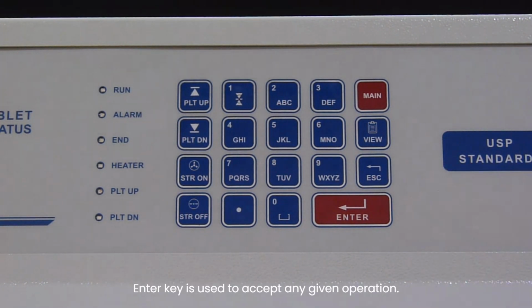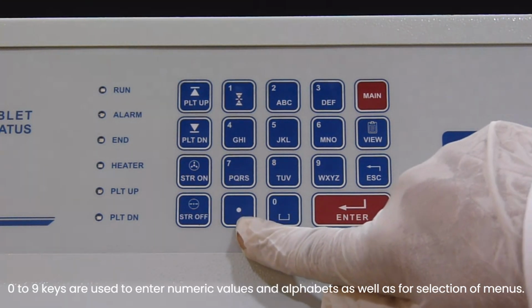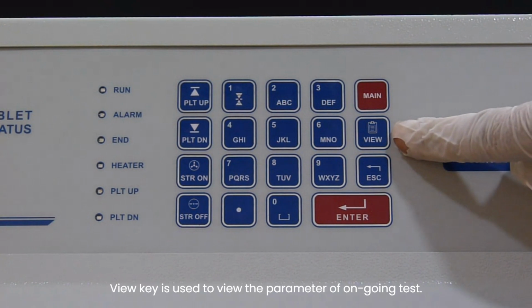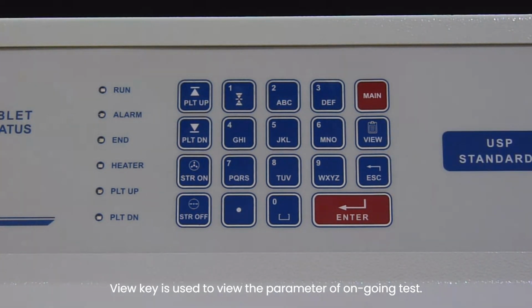Enter key is used to accept any given operation. 0 to 9 keys are used to enter numeric values and alphabets as well as for selection of menus. View key is used to view the parameter of the ongoing test.